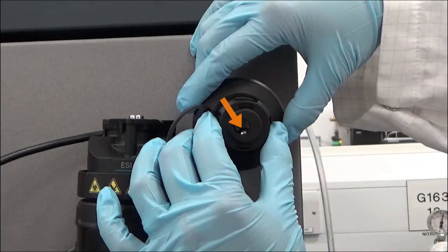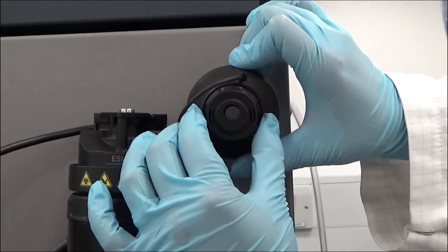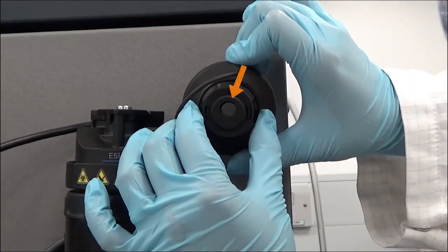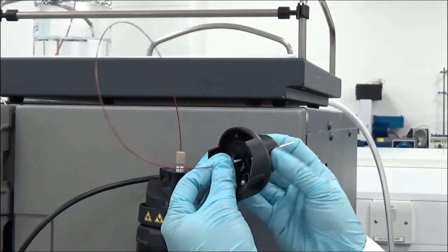Tilt the probe adapter cap so that the ball bearing falls into the recess within the cap. The aperture on top of the cap is off-center to indicate the location of the recess. Insert the probe assembly through the aperture.